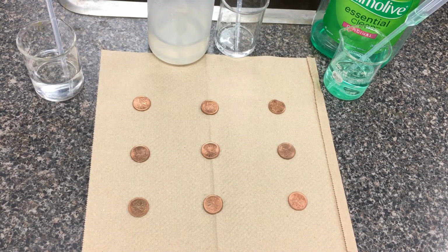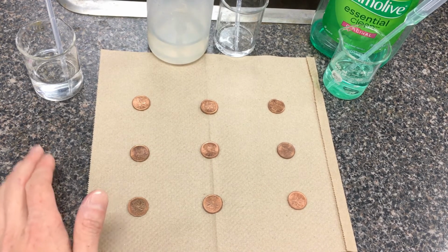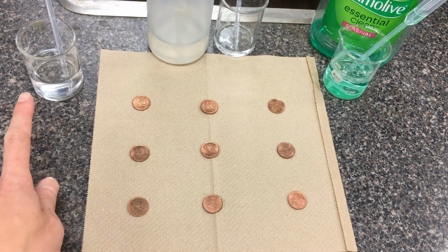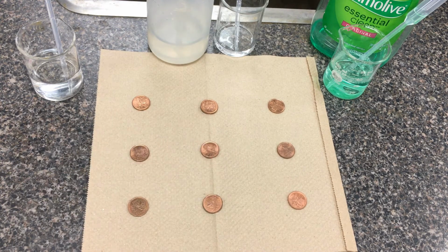All right, so in this lab, we're going to be investigating different intermolecular forces between three solutions. We have tap water, methanol, as well as a soapy water solution. The way we're going to be doing this lab is we're going to be using these droppers. Individually, we're going to be dropping little droplets on top of these pennies.